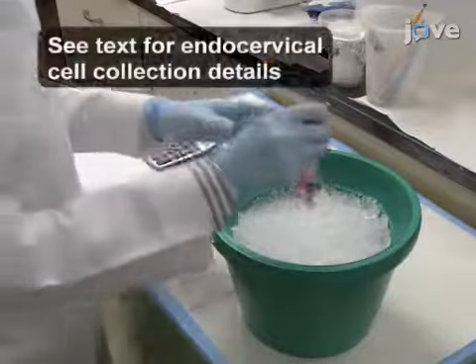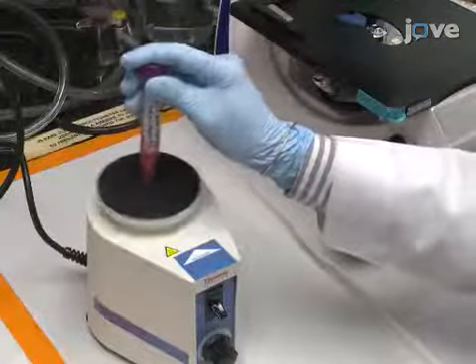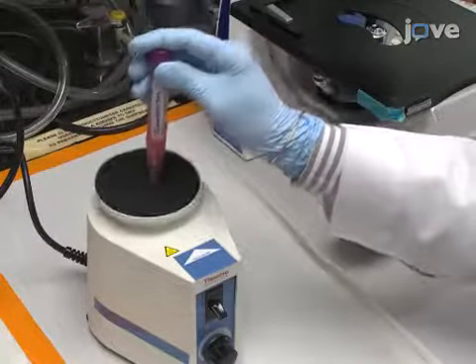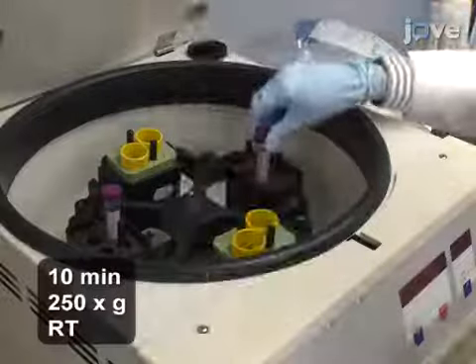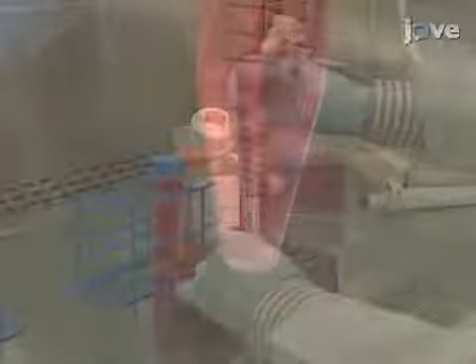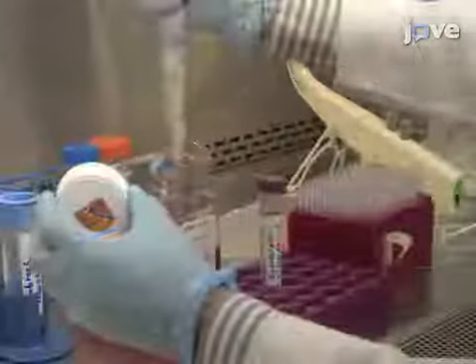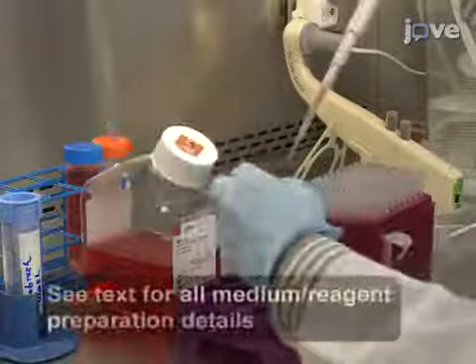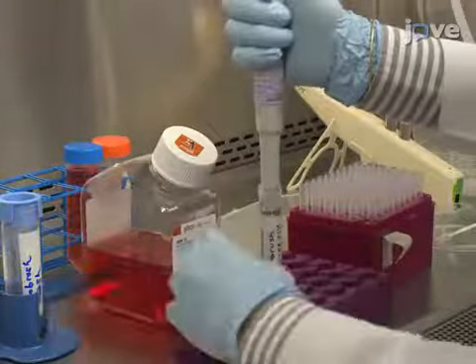Immediately after collection, place the tube containing the cytobrush on ice. Within one hour of collection, vortex the tube containing the cytobrush for four pulses of 10 seconds. Then centrifuge the tube and carefully remove the brush without disturbing the pellet. Next, add one milliliter of IMDM medium to the cells and place the tube on ice.